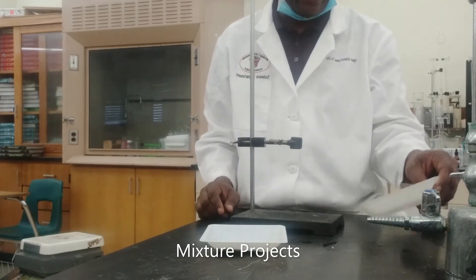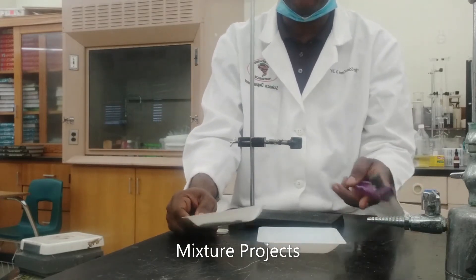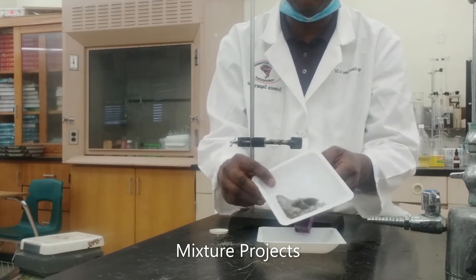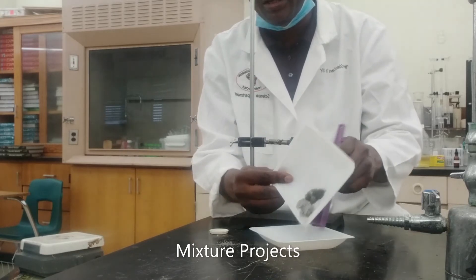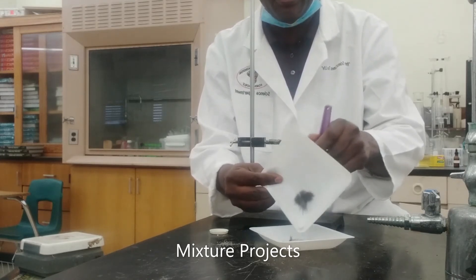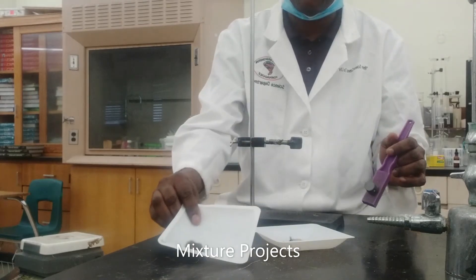So we're gonna start by separating the iron out using a magnet. I usually advise not to place the magnet directly into the mixture, but rather you can place the magnet underneath the dish and go ahead and swirl. You notice the iron remains behind while the salt and sand are separated.